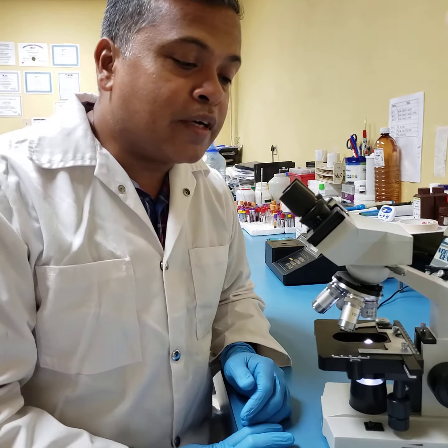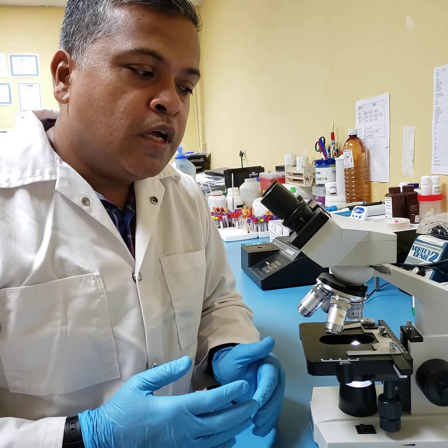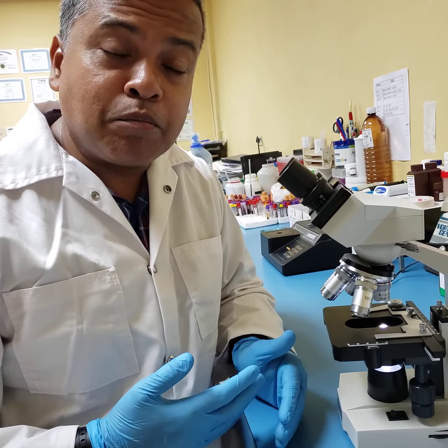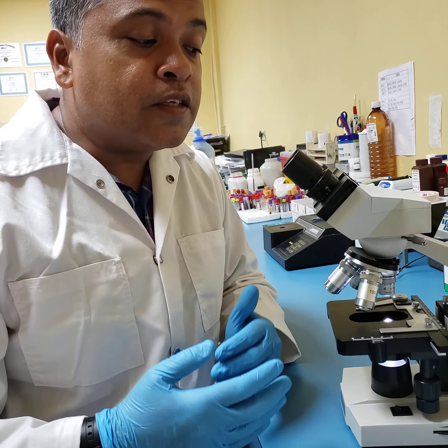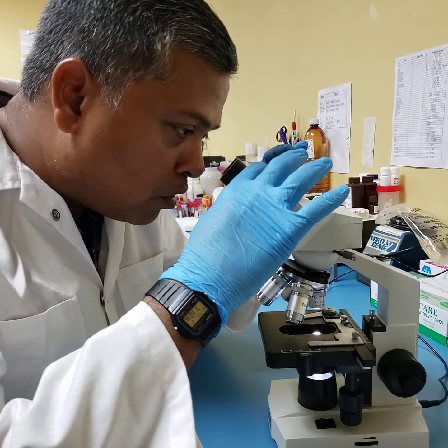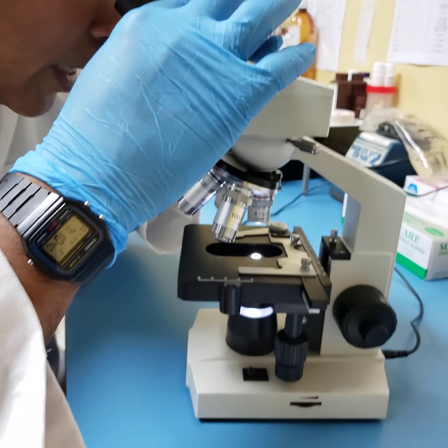It is common practice for any microscopist who is coming to use the microscope. Usually in laboratory environments, one technologist may call on another person to come and look at a sample so that they could discuss it. It is common where one microscopist would leave the microscope and bring his or her colleague to look at it, and every colleague that comes will adjust the eyepieces to suit their own eyes.